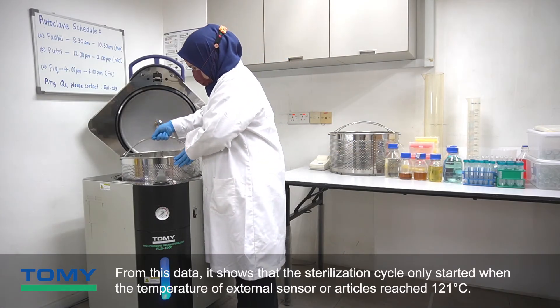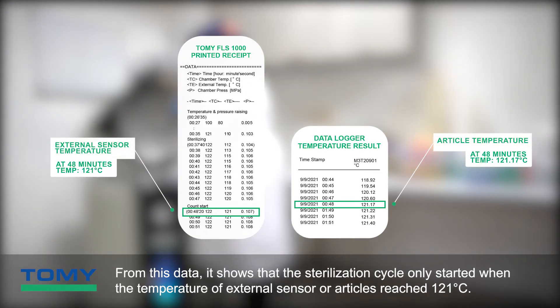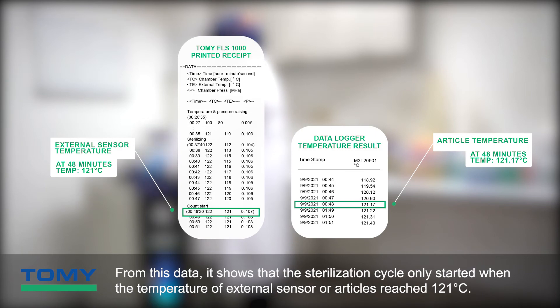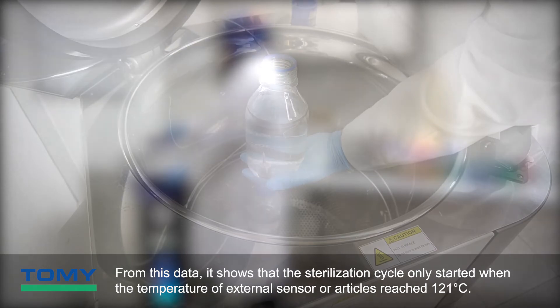From this data, it shows that the sterilization cycle only started when the temperature of the external sensor, or articles, reached 121 degrees Celsius.